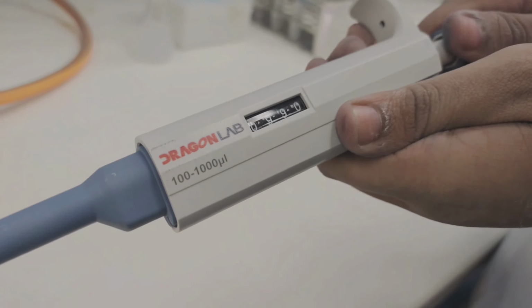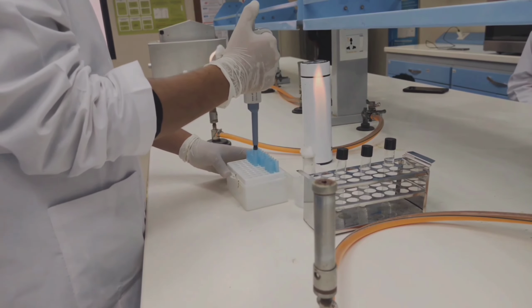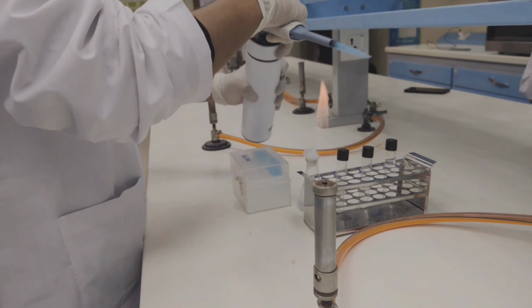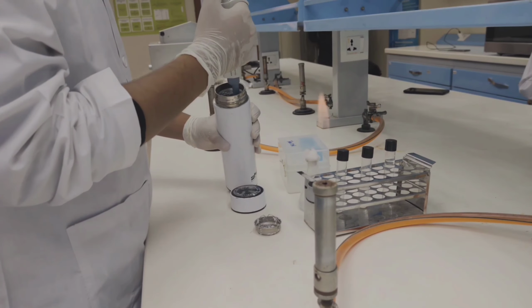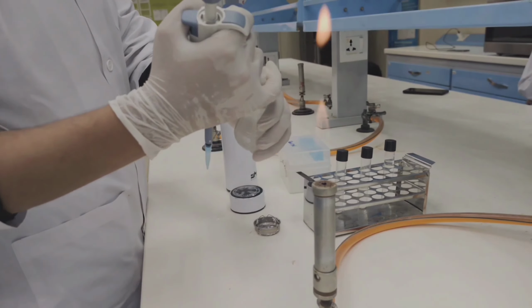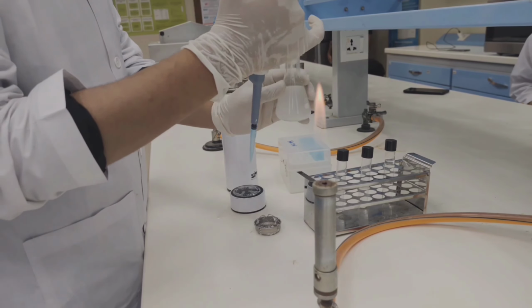Now we have to form dilution. First of all, we have to take micropipette and take tip of it. Make sure these steps happen in aseptic zone to avoid contamination. Then we have to take 1 ml sample and inoculate in a flask in which diluent is present.